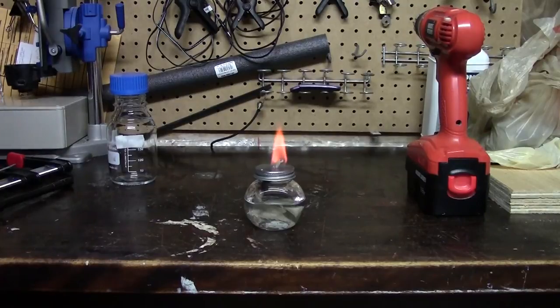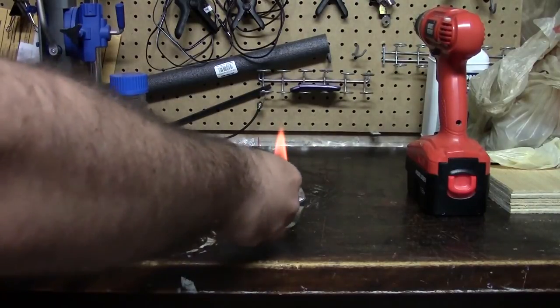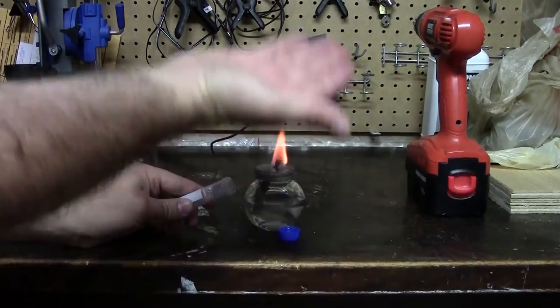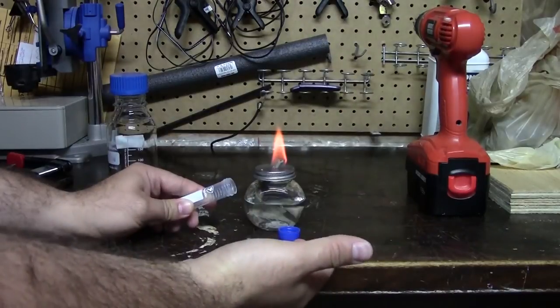For example, if I open a tube in this area and I put the lid here, I know it shouldn't get contaminated because the area here is moving upwards and so dust and stuff should not fall into the tube.